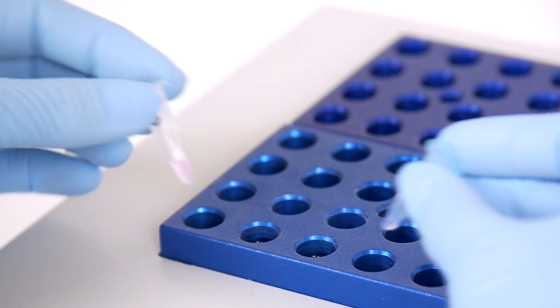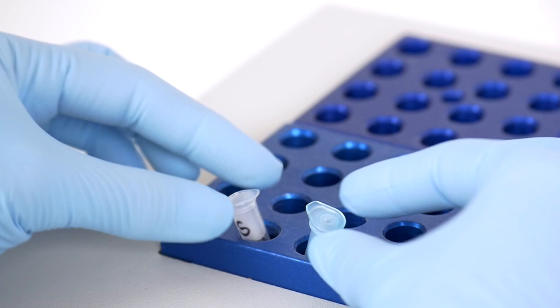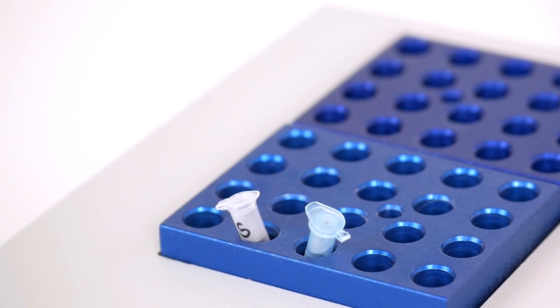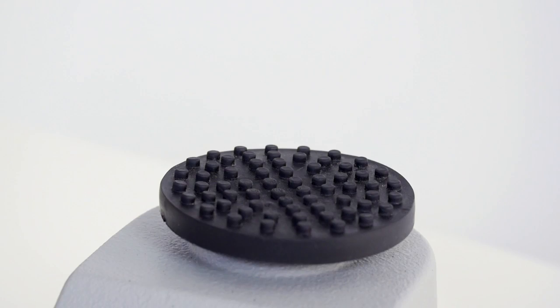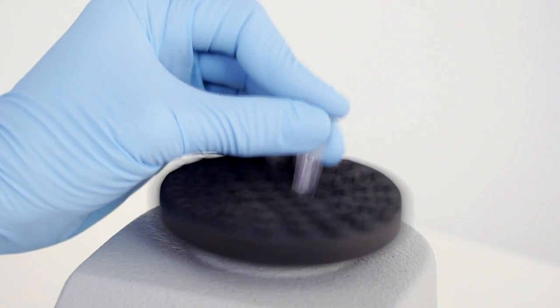Take the sample and biotinylated ladder that you've just prepared and place them on a heat block set at 95 degrees Celsius or a water bath for 5 minutes. Once this is done, just do a quick vortex and spin.